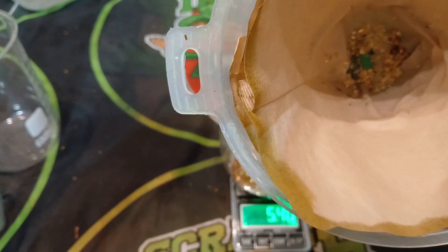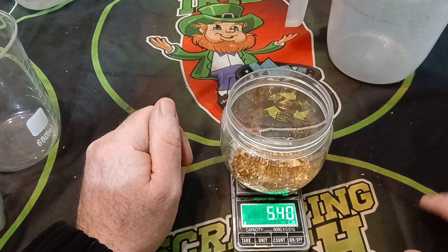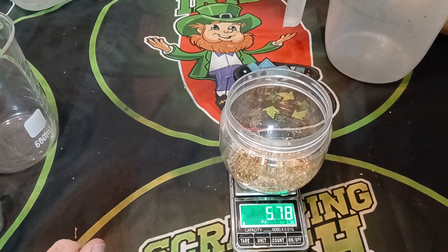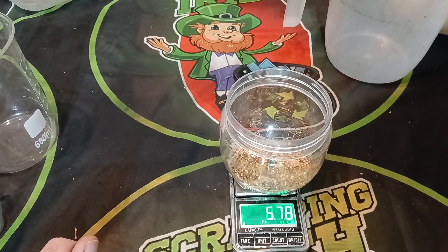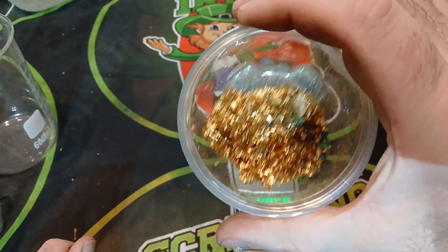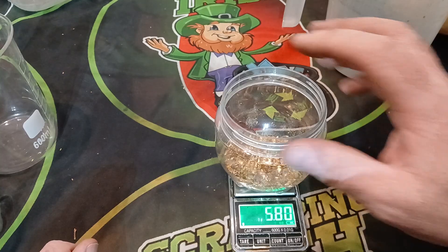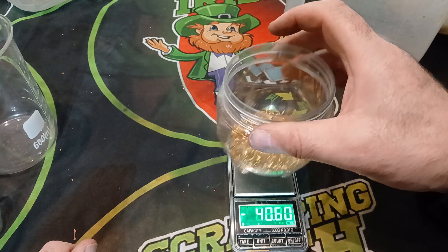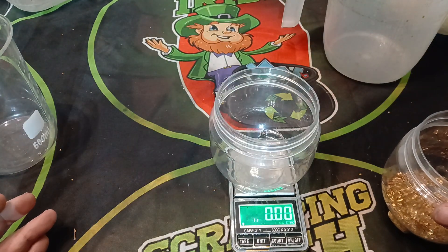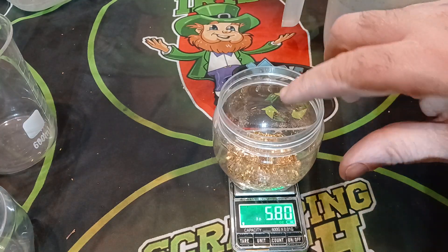I forgot to put these few bits in, but that might bring the weight up — might as well add them in. After adding, it's changed to 5.78 — so 0.38 more. It's 5.78, all added in now. Some of that might be a little bit of green residue but it should dissolve in the HCl and bleach. When stirred up it's reading 5.80 to 5.81 grams. The scale is confirmed zeroed, so we have 5.8 grams of gold. Let's get this into the HCl and bleach.